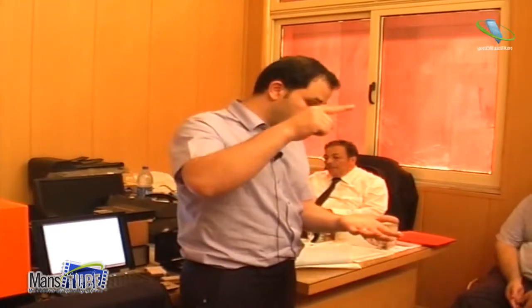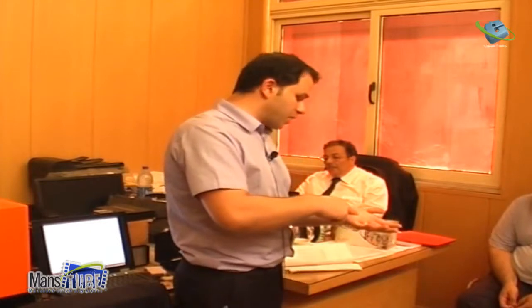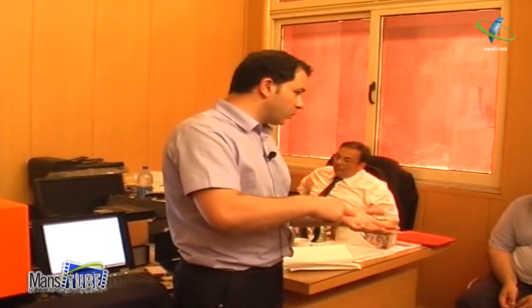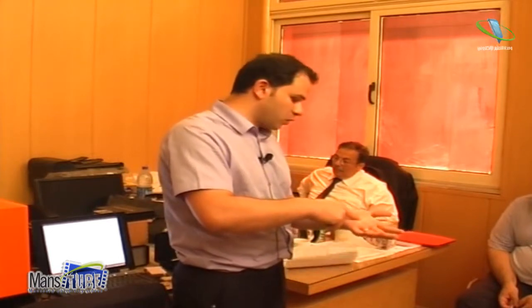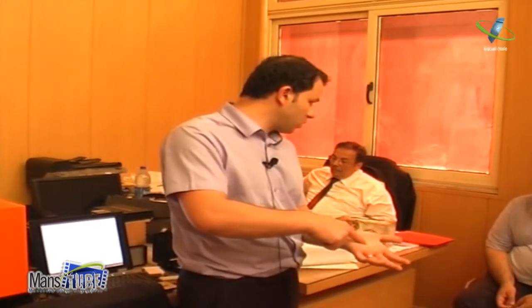And then with the advanced spectroscopy, for example, when we touch the surface, we can make it stop. And then we can measure if there is an elastic deformation over time. For example, you press like this, and then we see what happens. Does something change in the material over time, or is it still fixed? Then you can measure the elastic deformation of the material with the AFM.